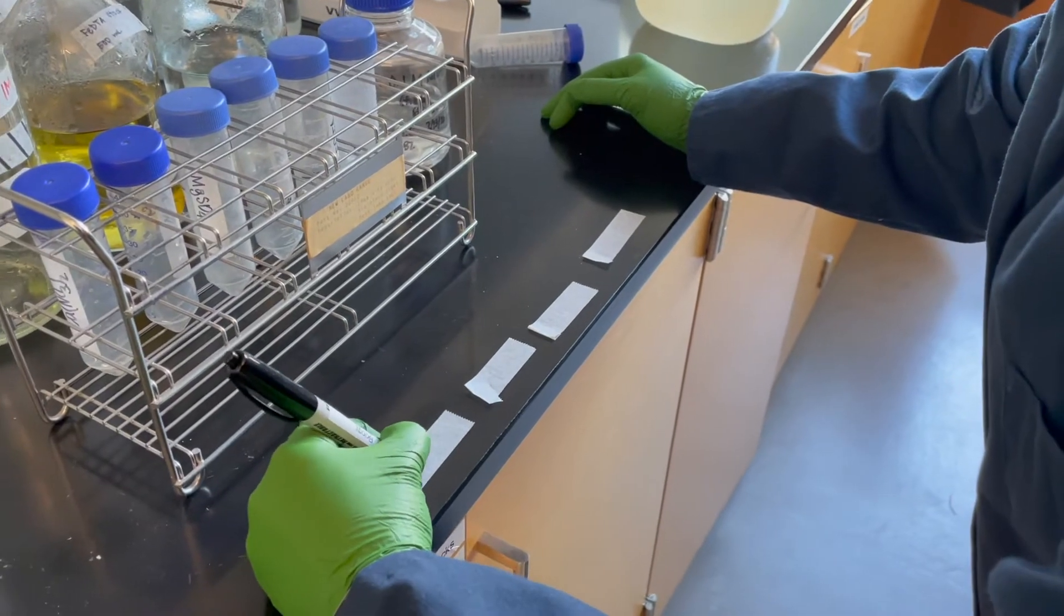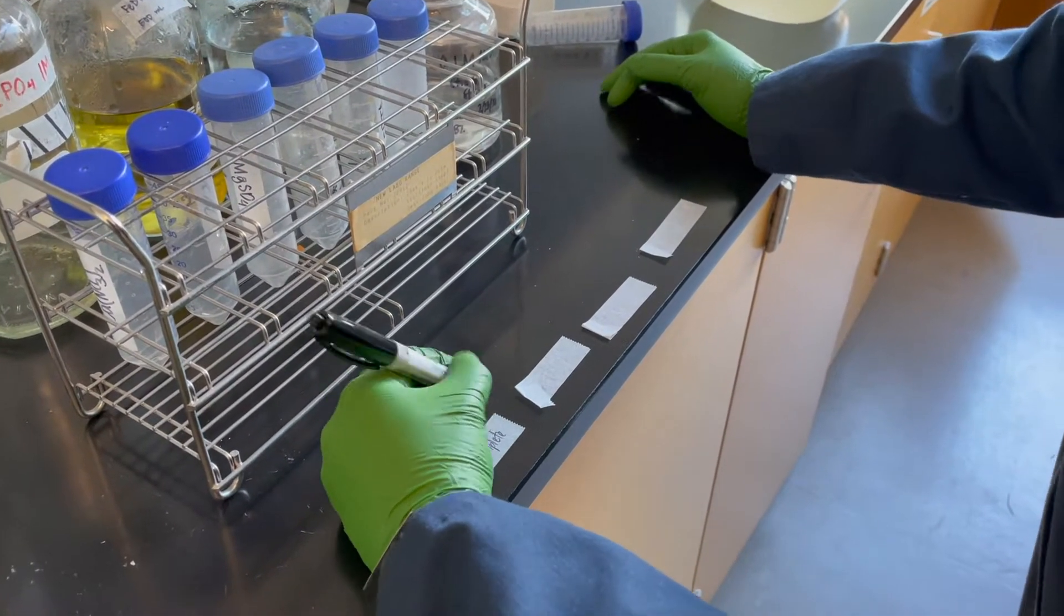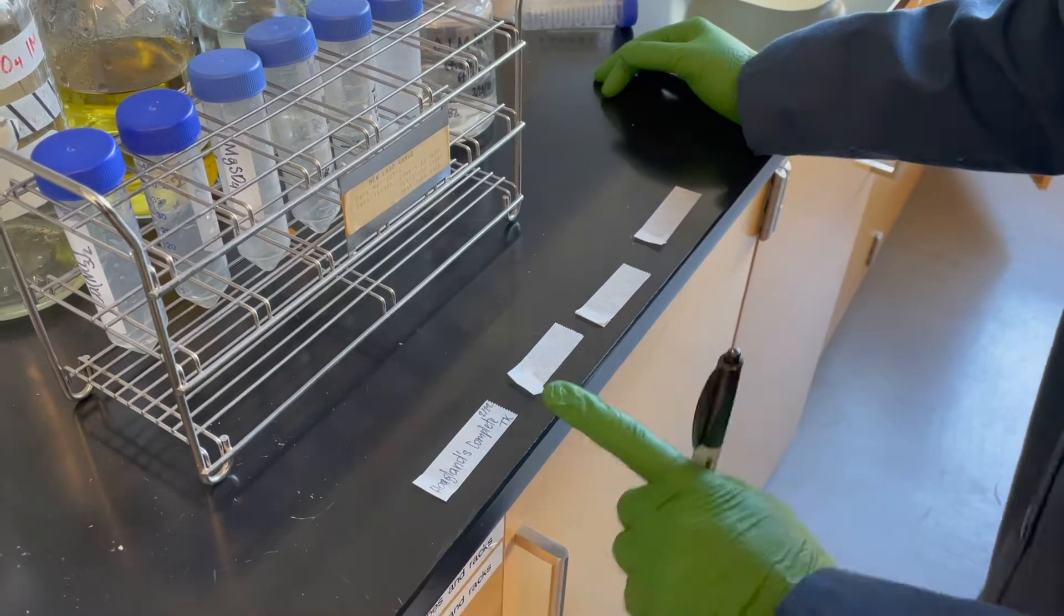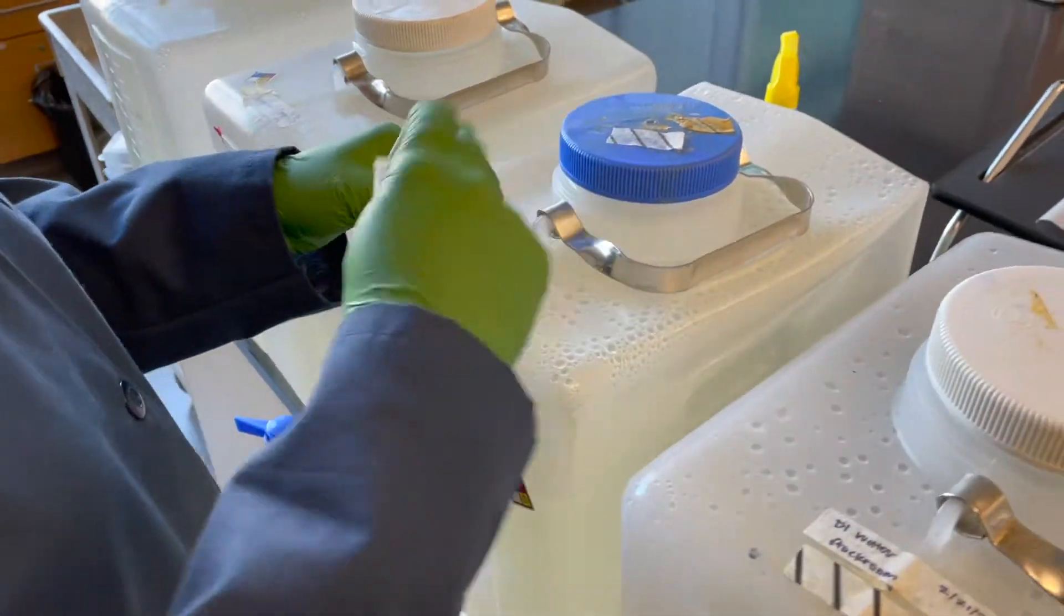Write what it is, initial who made it, and the date. Make sure you remove all the old labels.